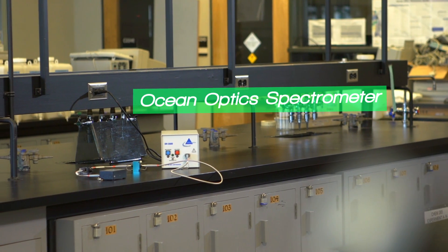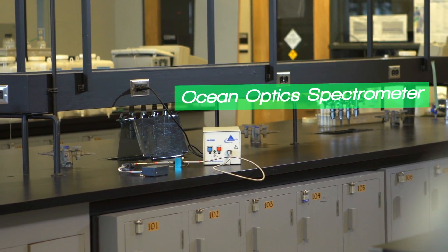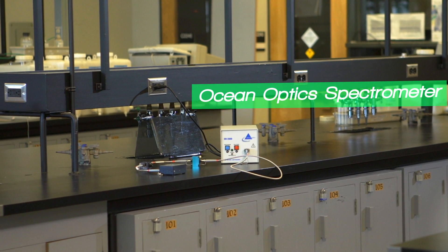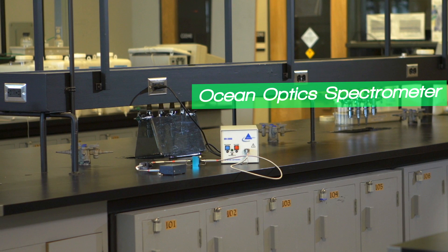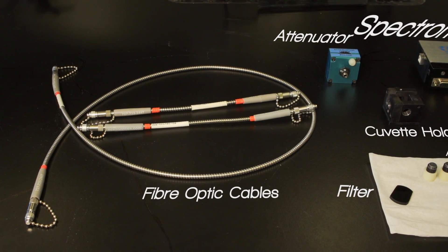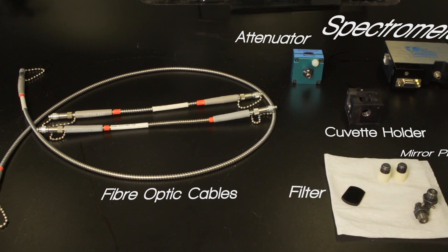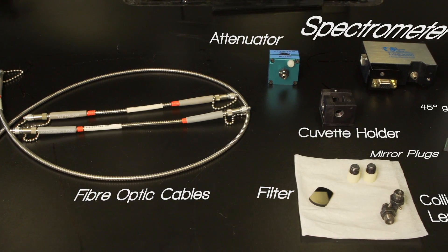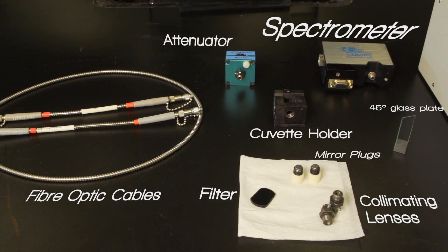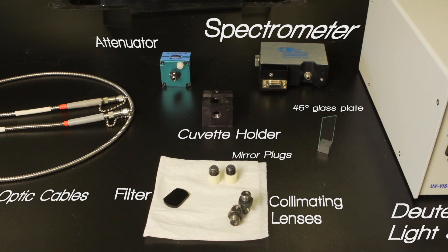In this experiment you will use multiple instruments. The instrument that we will focus on is the Ocean Optics spectrometer. This spectrometer is modular — it can be used to take absorbance and fluorescence measurements. Depending on which is being measured, the configuration of the parts varies.